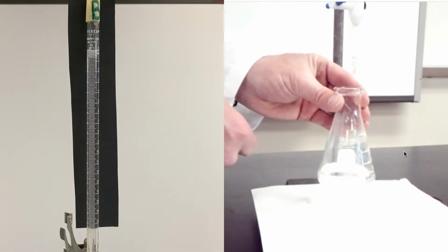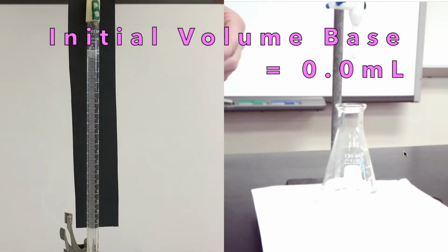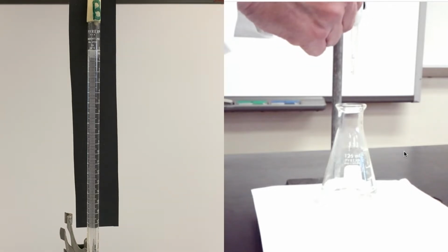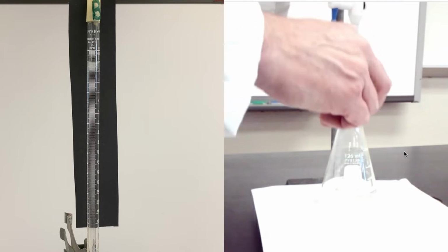In here, I've got my acid. Of course, there's some water and phenolphthalein. Right now, if you look at my base, I took the time and I made sure that I was actually right at 0, so that's my initial volume. Don't forget to record your initial and final volumes on your lab sheet. And so here we go. I'm gonna go ahead and shoot about 10 milliliters right off the bat.